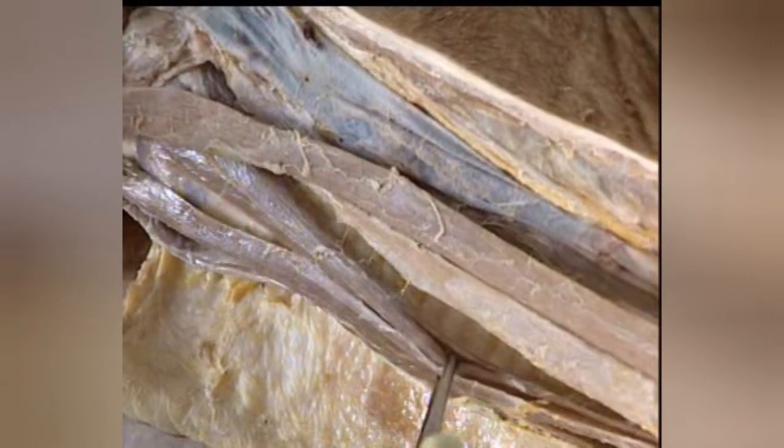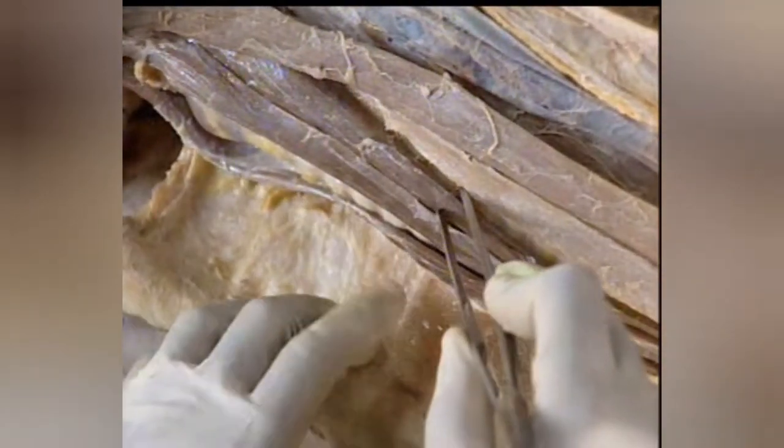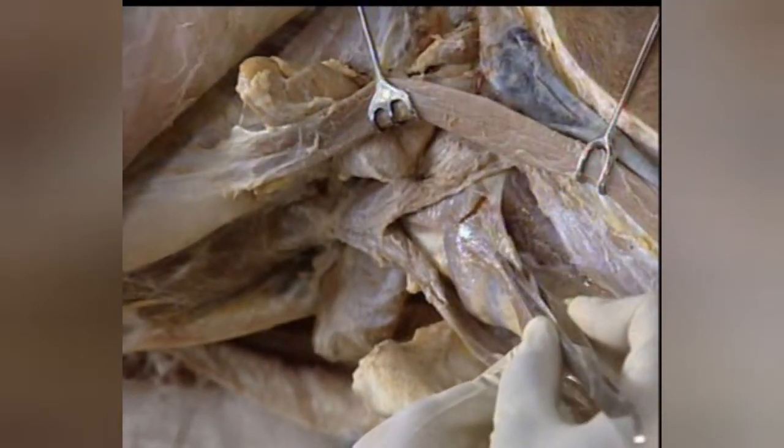Are you able to find two muscular bands on either side of the trachea and below the sternocephalicus muscle? This is the sternothyrohyoideus. It originates from the manubrium sterni, then passes upwards and forwards. The muscle divides at about the middle of the neck into two bands: the thyroid band and the hyoid band. The thyroid band is inserted to the thyroid cartilage of the larynx. Notice the hyoid band passing upward to be inserted to the hyoid bone.